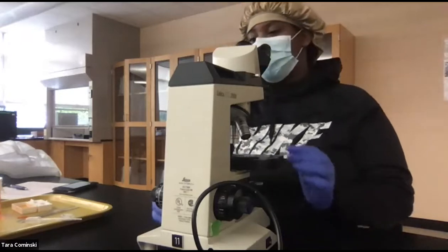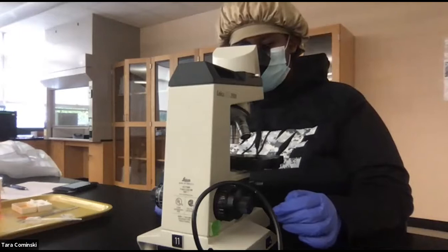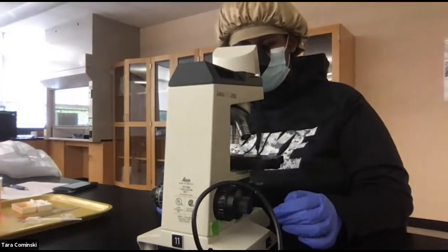I thought I found it. That's my eyelash. Yeah, sometimes your eyelashes get in the way. That's true. I'm like, I found it.